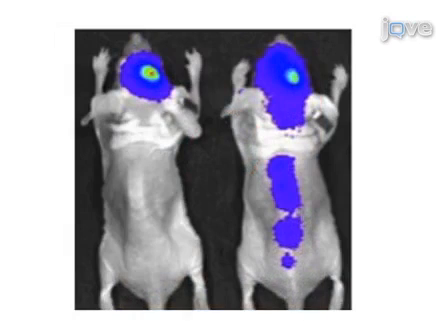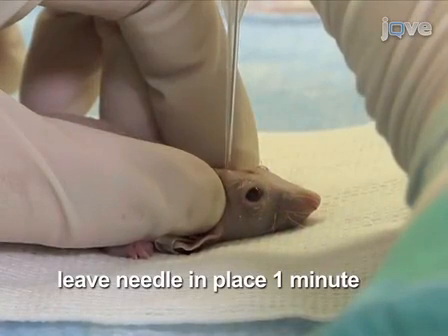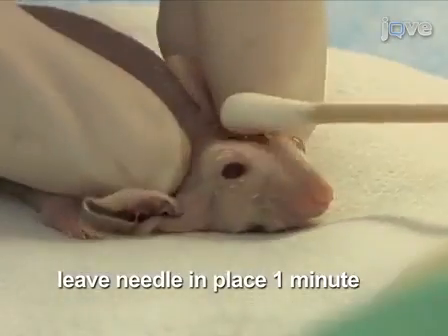An inappropriate angle of syringe insertion can result in intraventricular injection of cells and subsequent spinal dissemination, as shown here. Upon completing injection, leave the needle in place for another minute, then slowly withdraw. These steps will help prevent tumor reflux.